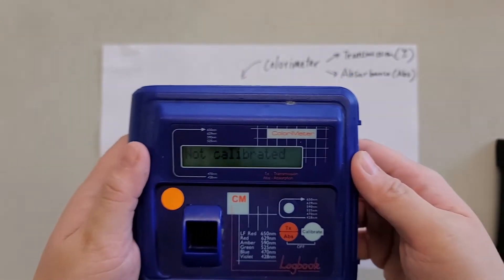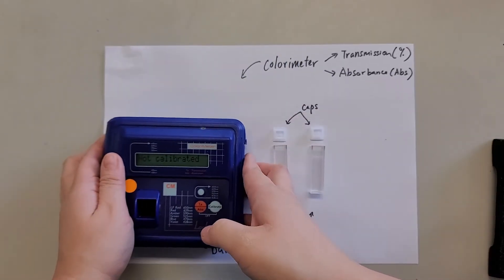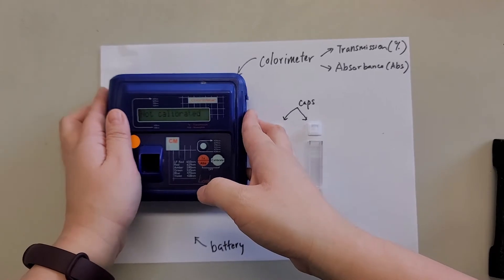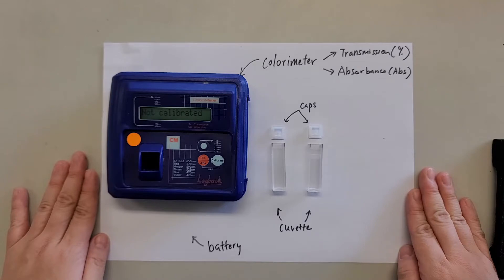So first of all, it will show it's not calibrated. What we need to do is calibrate it with the solvent that you use. Generally speaking, most of the time you will use water, distilled water as your solvent.